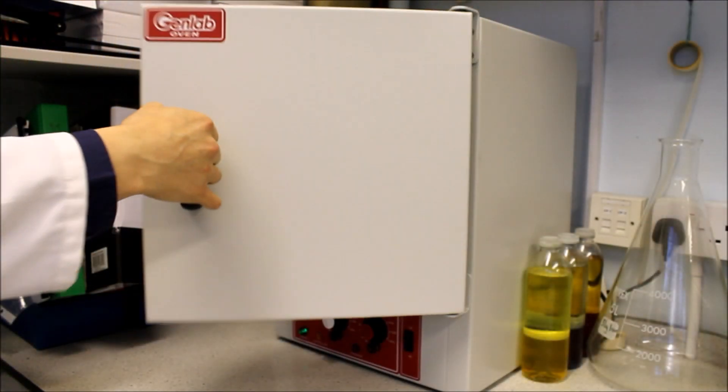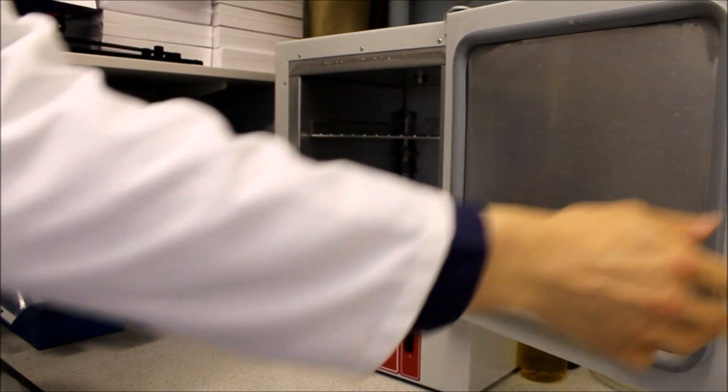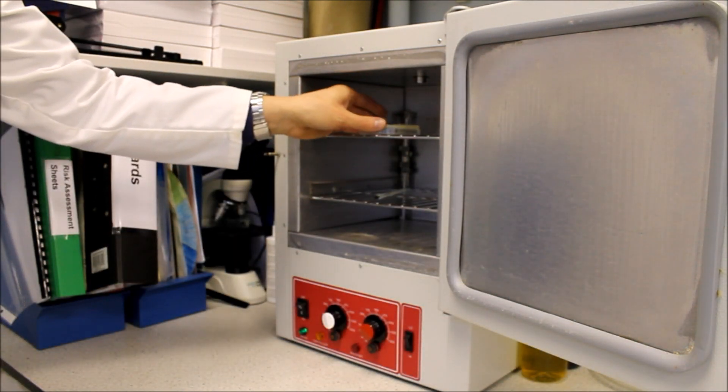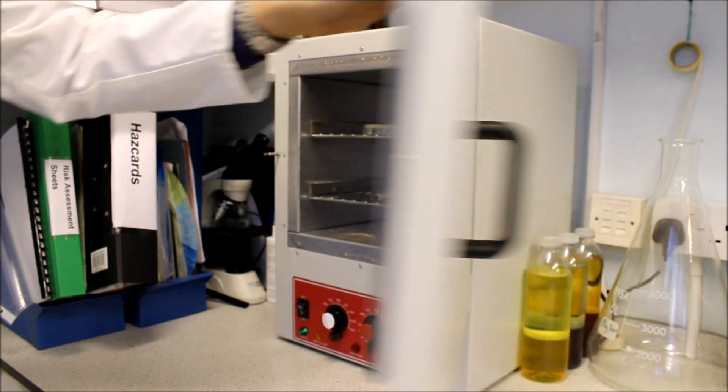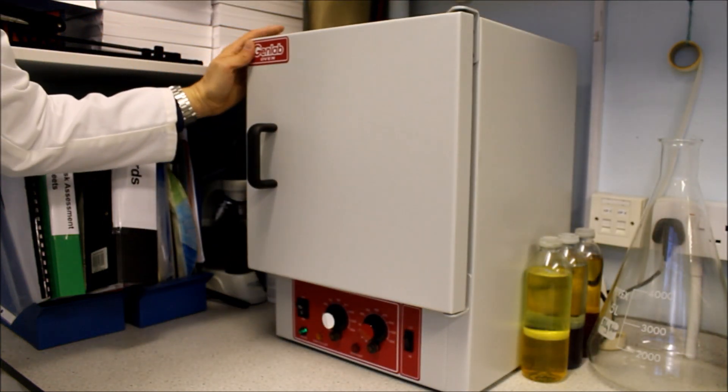The agar plate can now be kept warm or incubated at no higher than 25 degrees celsius for 48 hours. Any warmer than this and there is an increased risk of growing hazardous bacteria.